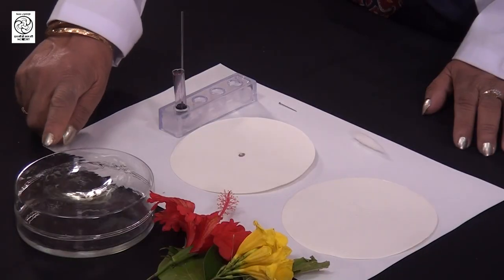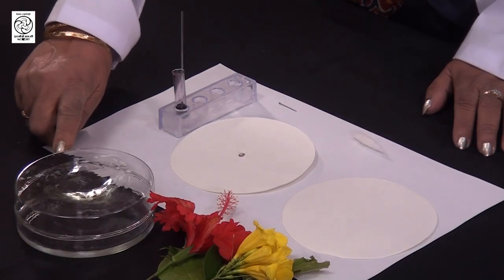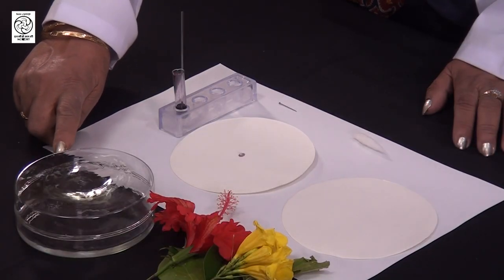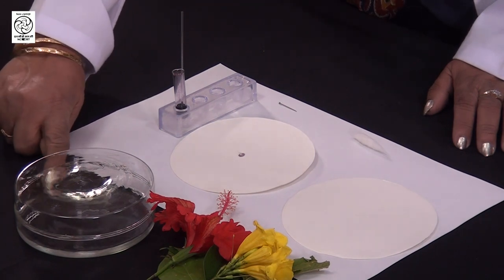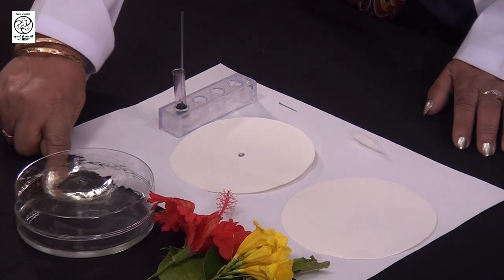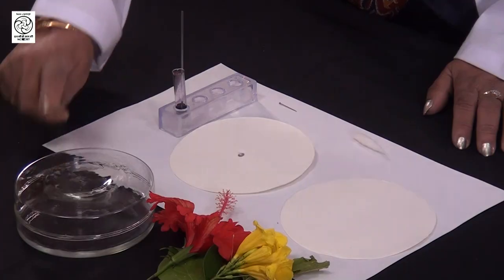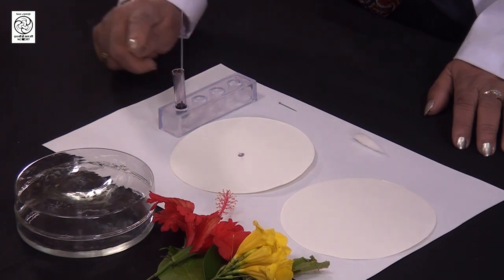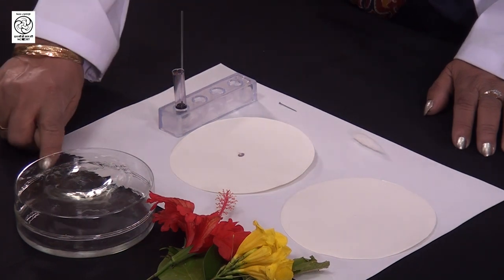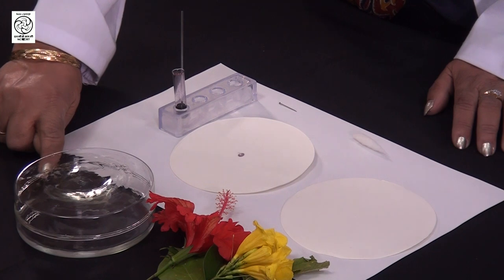I have here this development chamber or developing chamber. You can see some liquid is there at the bottom, and that is our mobile phase. Depending upon what compounds are to be separated, we choose our mobile phase here in the development chamber.